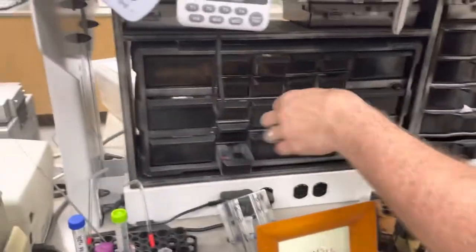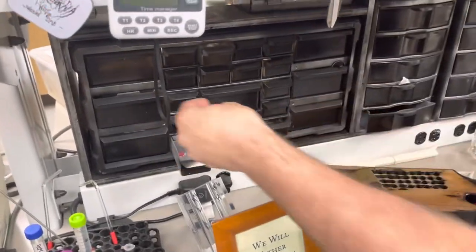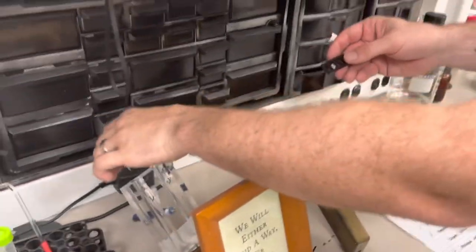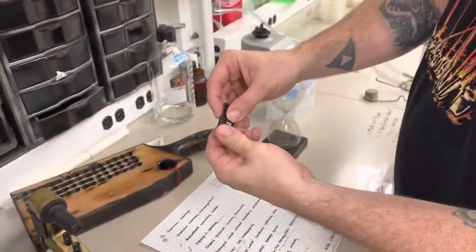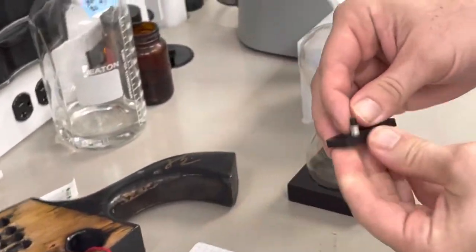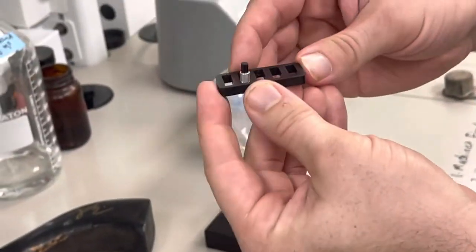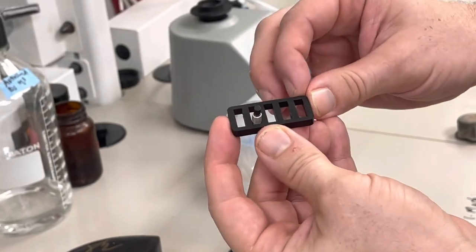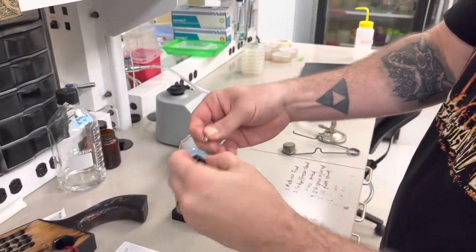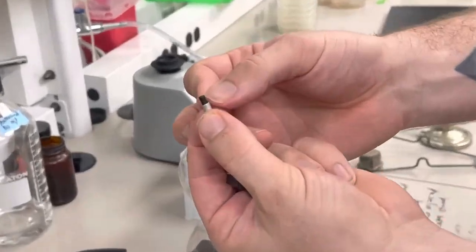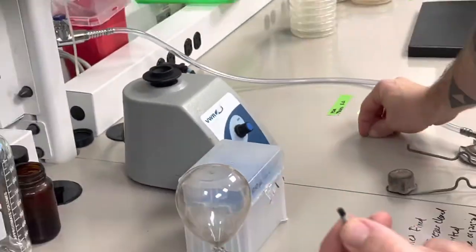Over here there is a drawer. This is actually the last flint. So here's what it should look like. You buy these little flint replacements. This is what the striker flint looks like. If you compare this to this, there's no flint. That's why it's not sparking.